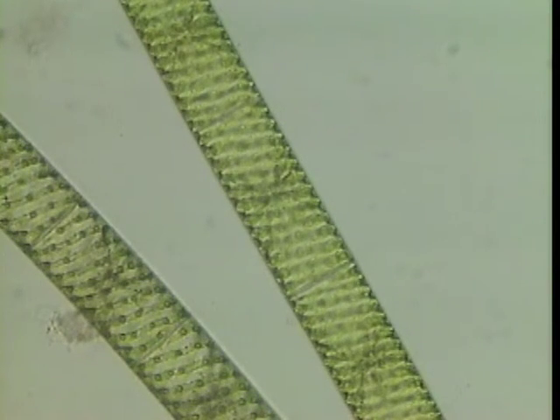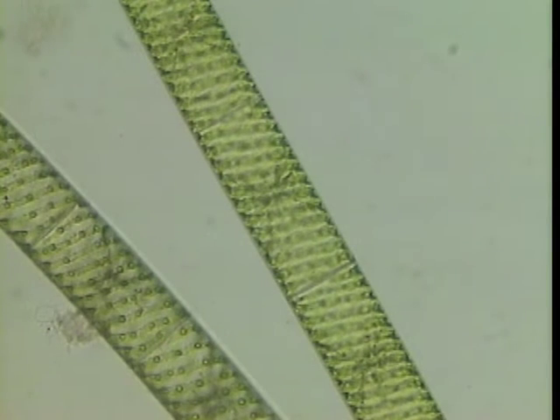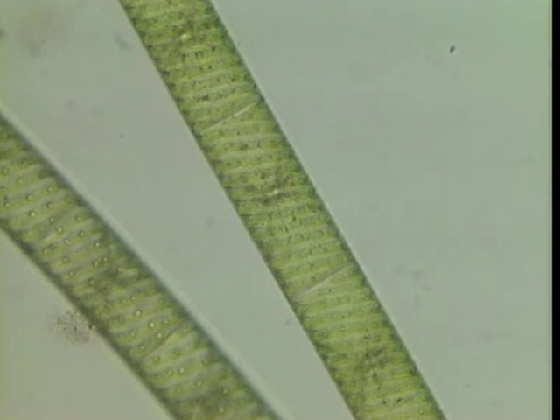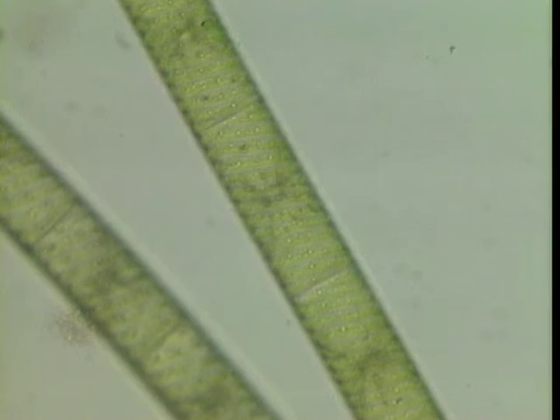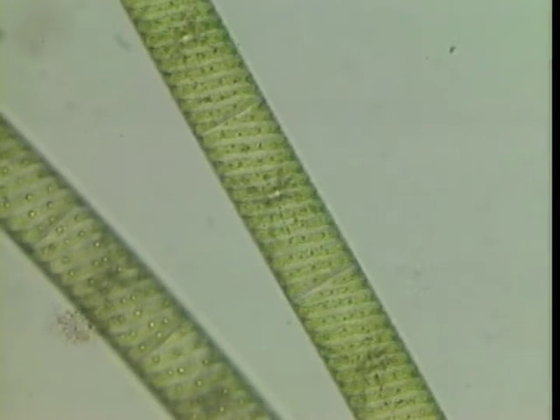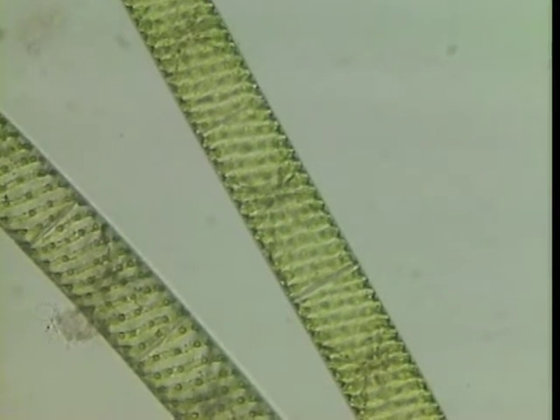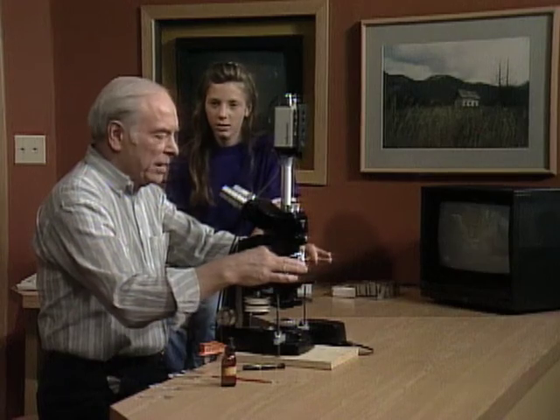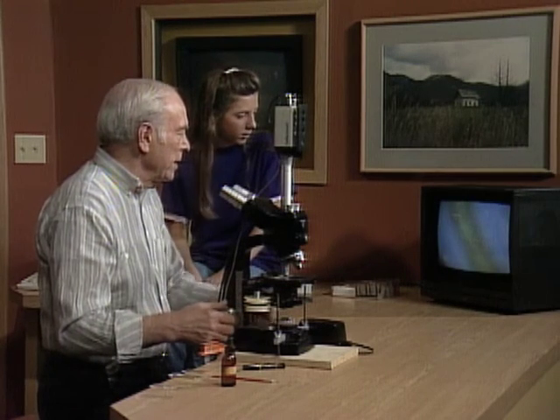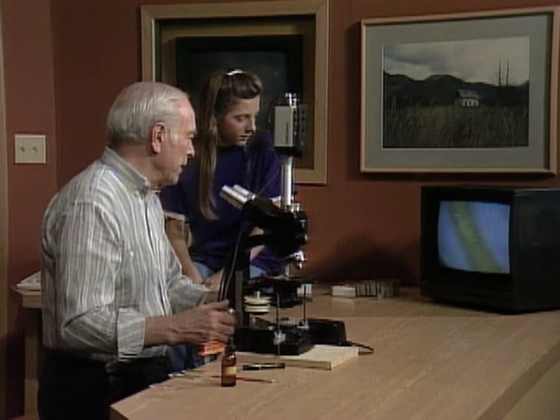I'm now focused on the top layer, and now I'll slowly go down through. It almost looks as if it's moving — sort of like it's moving. Now hold on, I'll go to a little higher magnification, because now you can see the spiral effect.